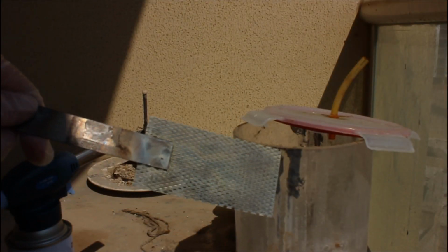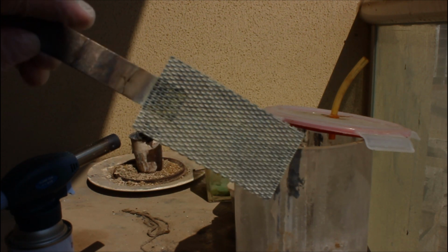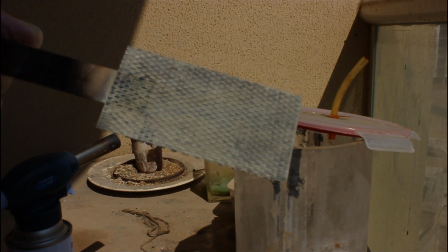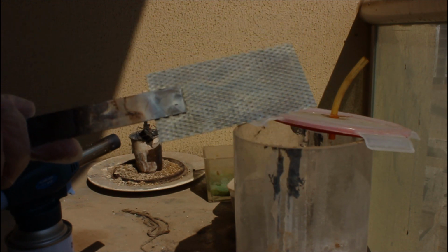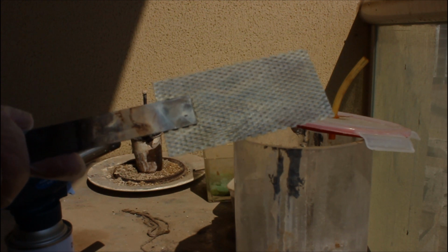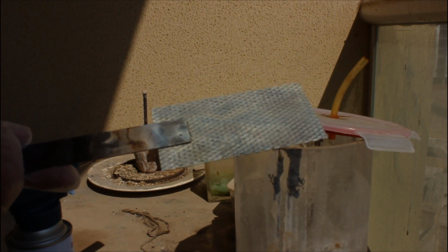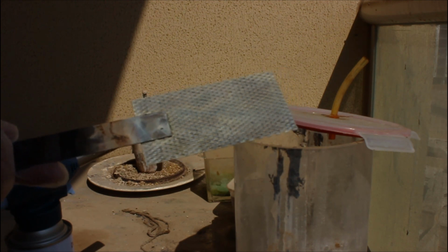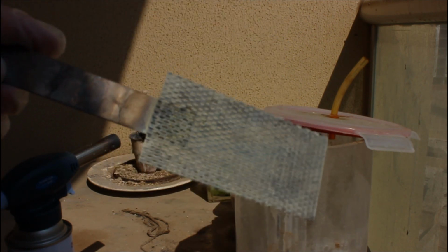After baking like a madman, we've achieved the desired yellow color. This is exactly what we want. So it turns out, I just wasn't baking it hard enough. You actually need that titanium dioxide to form, but then eventually the other oxides start to decompose and the color takes over. So we got a nice electrode that's good enough for the next step.